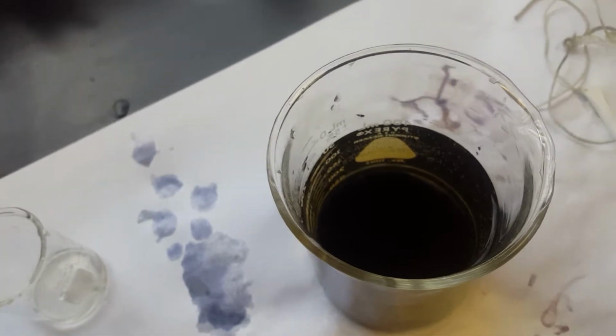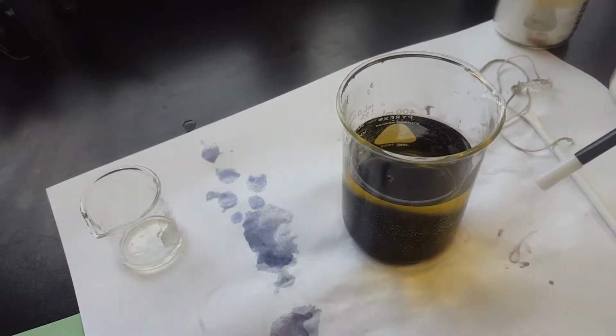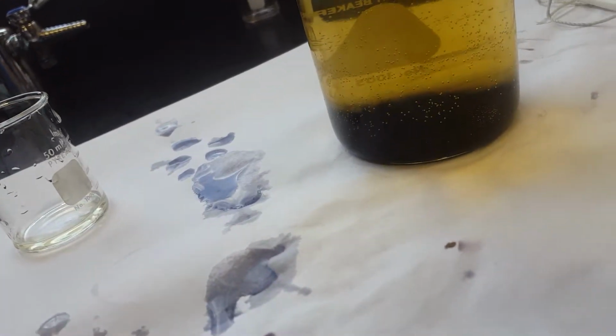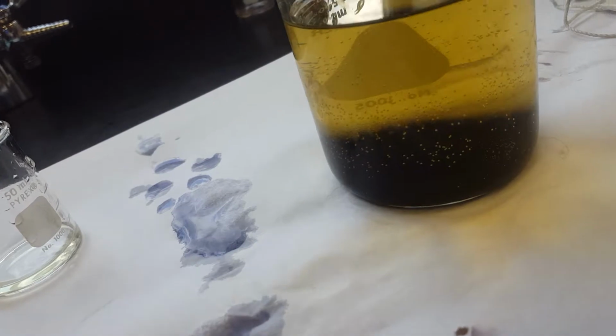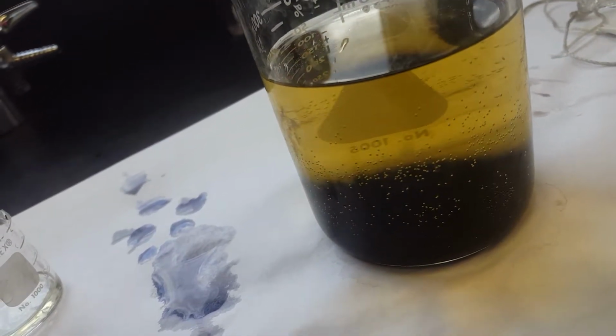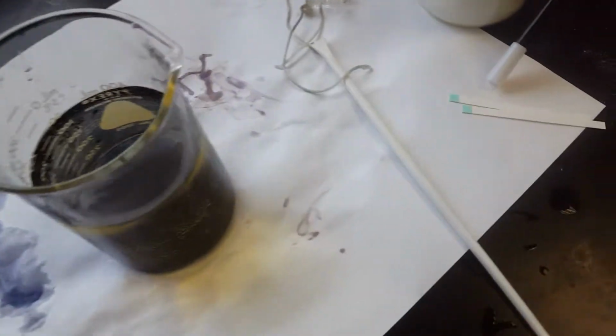And then you also are going to need to test for glucose. Student assistant number 1, does the iodine tell you if there's glucose in there? No, it did not, right? It only turned colors for the starch, not for the glucose. So to test for glucose, we're going to be using these little guys. These are called glucose test strips.